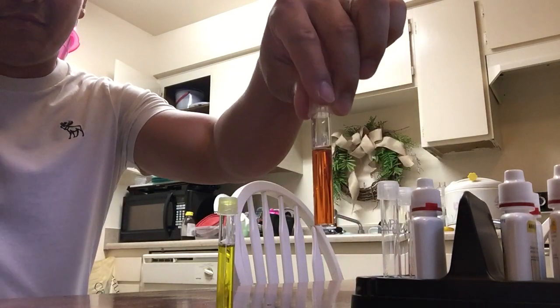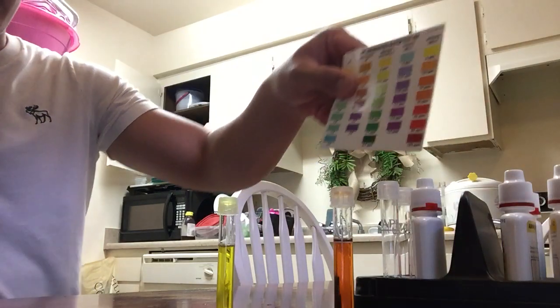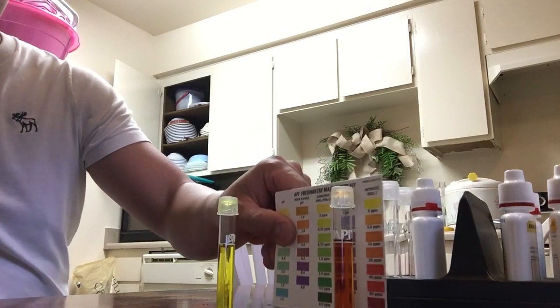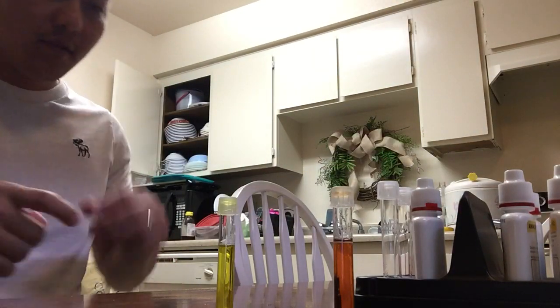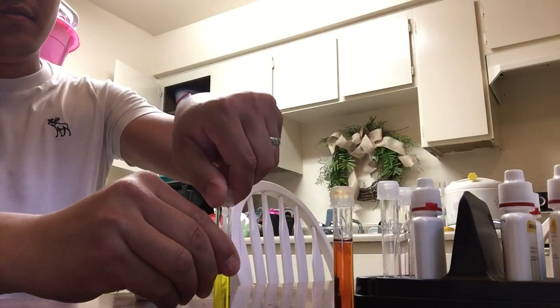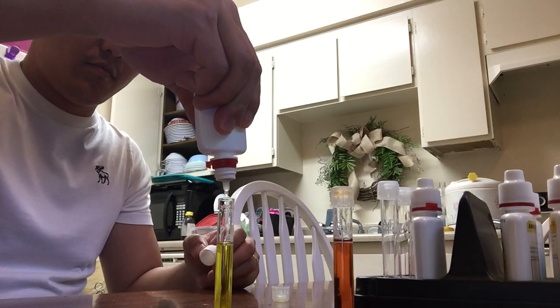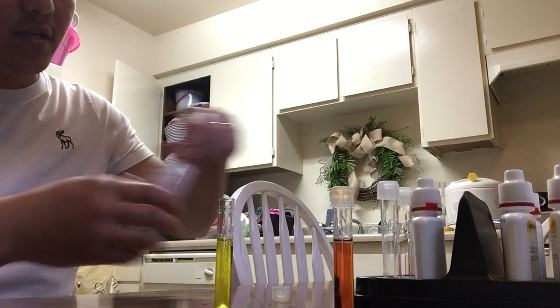You can tell this water is pretty bad with nitrate right off the tap — we are getting more red. Nitrate is cheap. We'll compare that once we're done. Shake it for one minute.